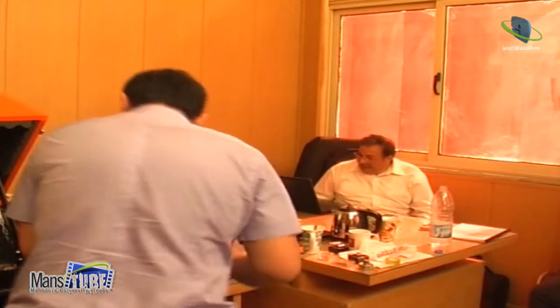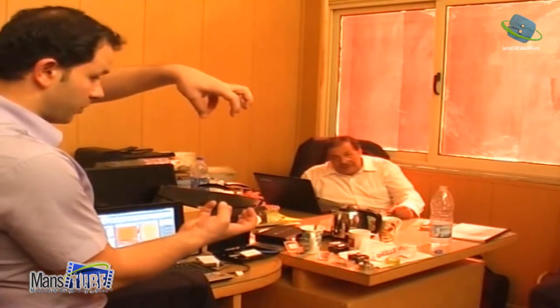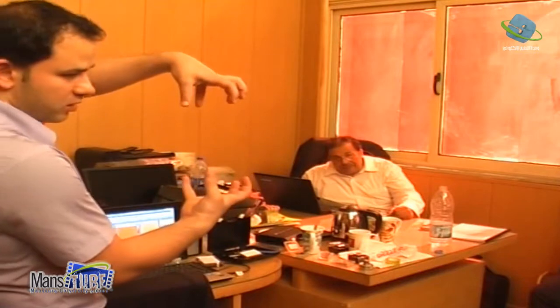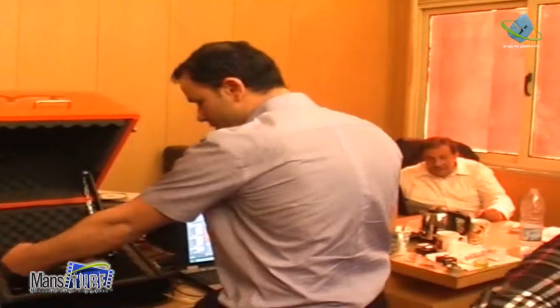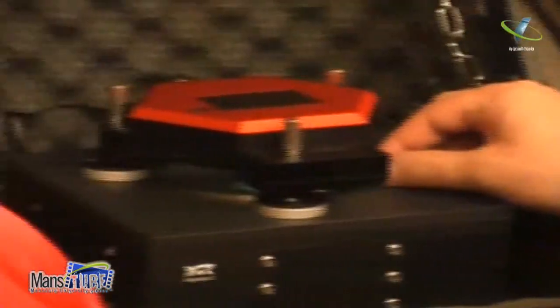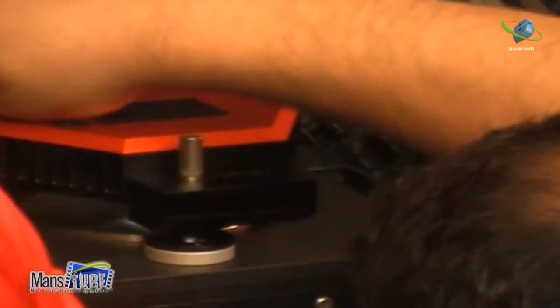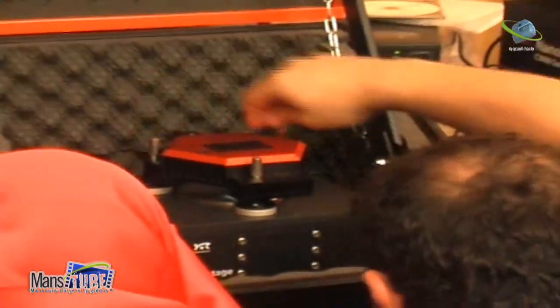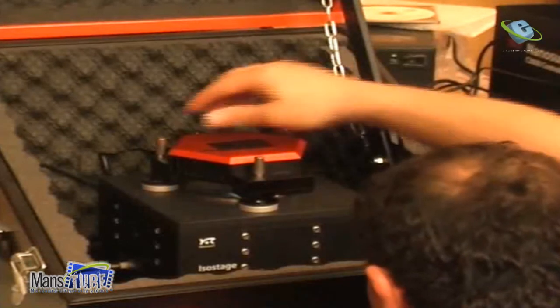And now what I will do, I will put my sample, and maybe you can see, when you put two droplets of liquid, when you come together, they will stick together. And if somebody wants, you can see from this side. There is no camera to see, but if you look from that side, you will see it. You can come from here and see. I have my sample here. Maybe the height isn't right, first I have to go up. Okay? Now I go up already.